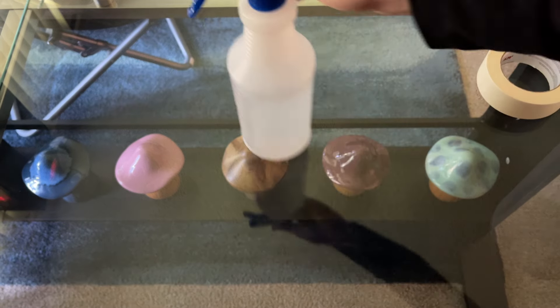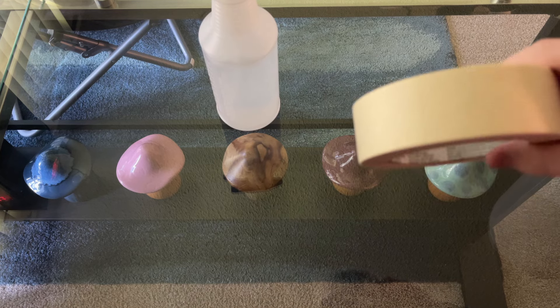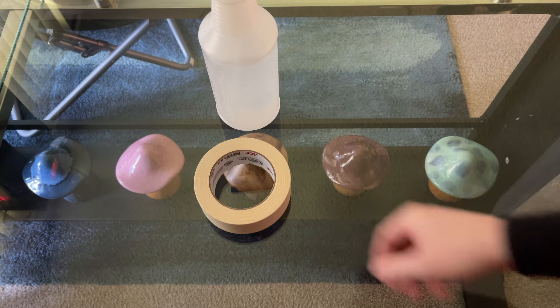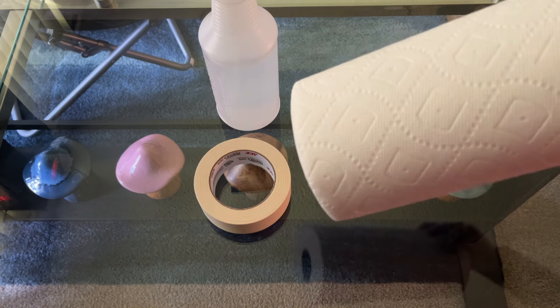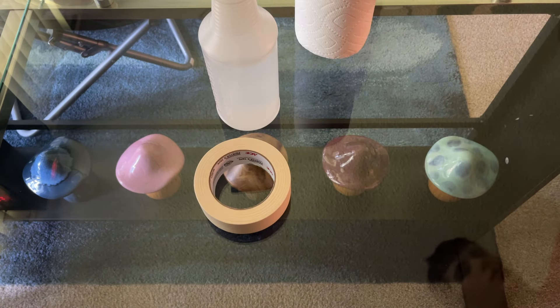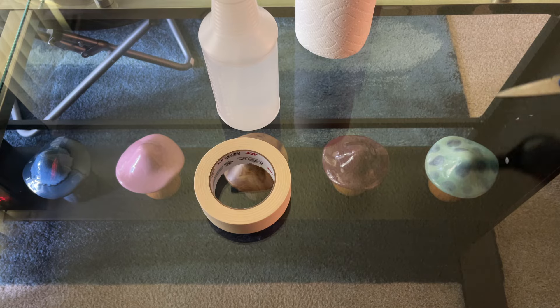So you've got the 70% ISO here. You're going to want to get some painter's tape — this is for the colonization step. You will need micro-pore tape when it comes to fruiting, but for now painter's tape. You're also going to want some paper towels and something sharp to cut open the bag, and make sure you sanitize it as much as you can.